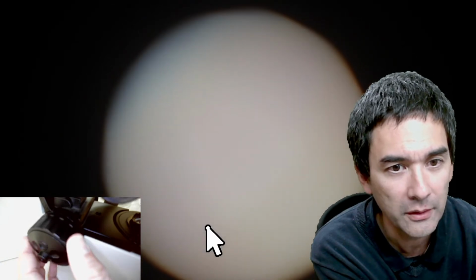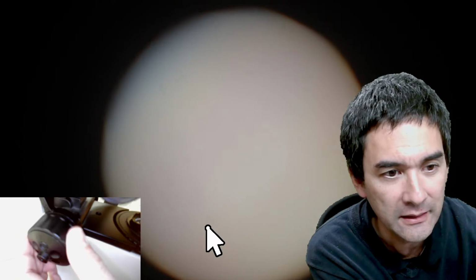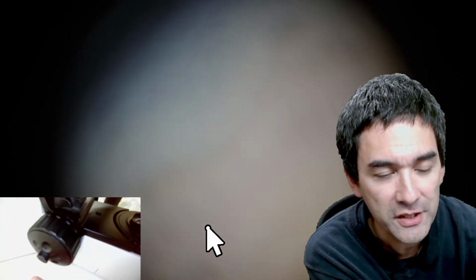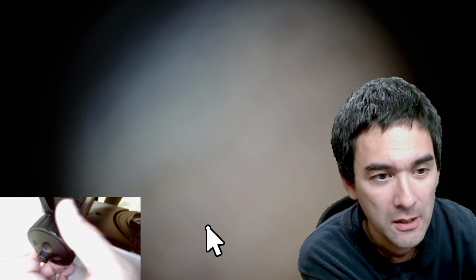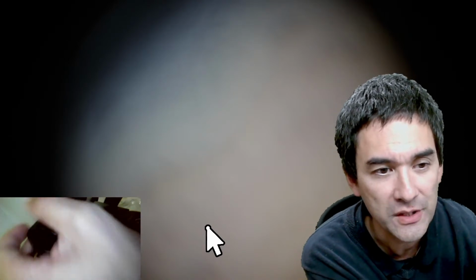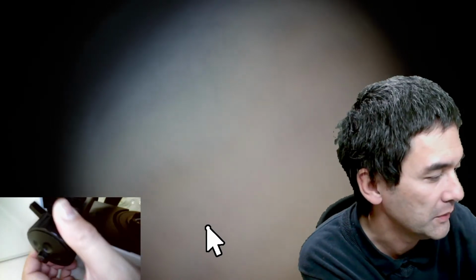I will lower everything, so I will lower the stage. I will put my drop of oil on the slide, and then I will go up again, and it will simply lock on this position, and it's going to be in focus. So there is no risk for me crashing the objective into the slide. Again, it's not absolutely necessary, but I will be using this lever here, and for this reason I just wanted to demonstrate this. It's called the focus lock lever.